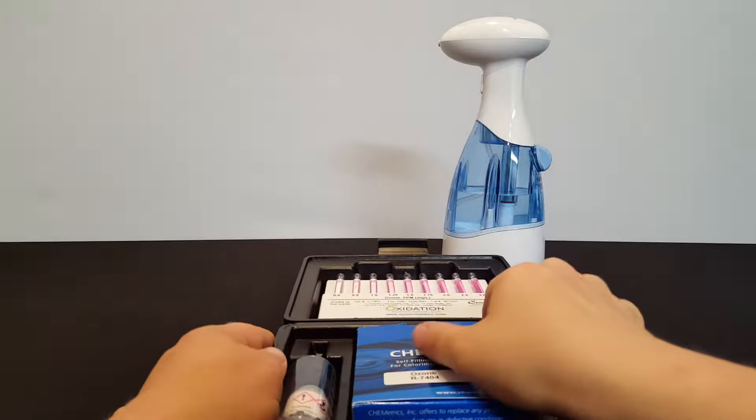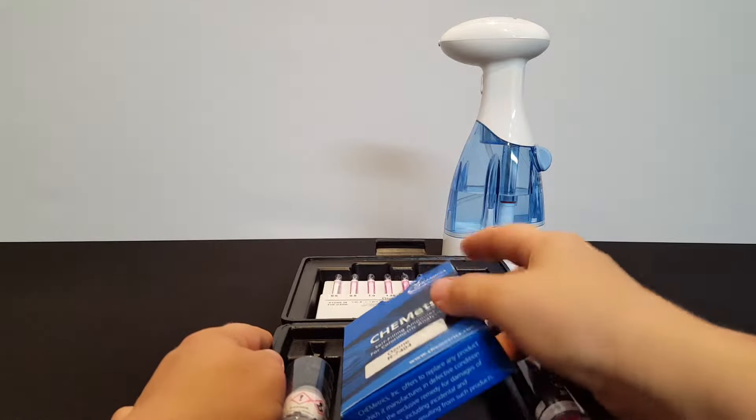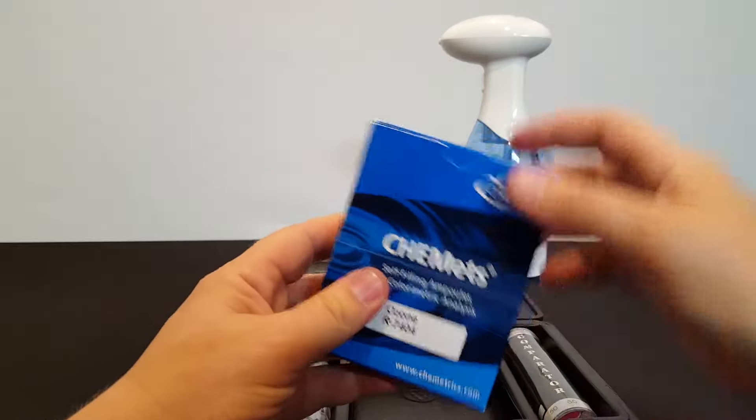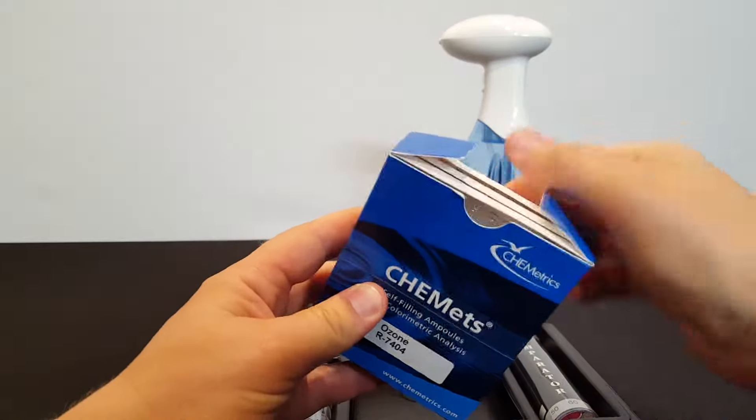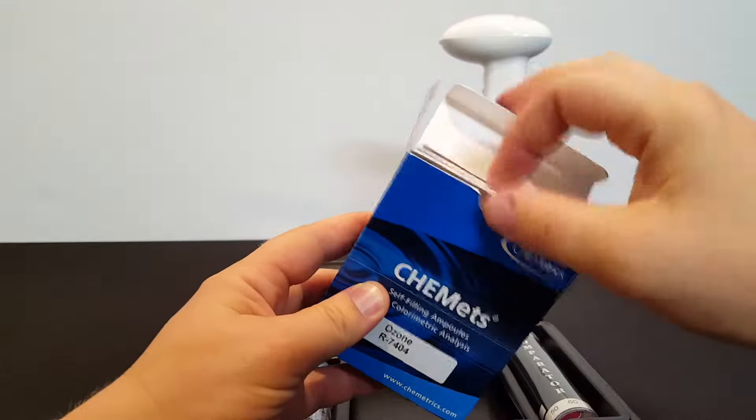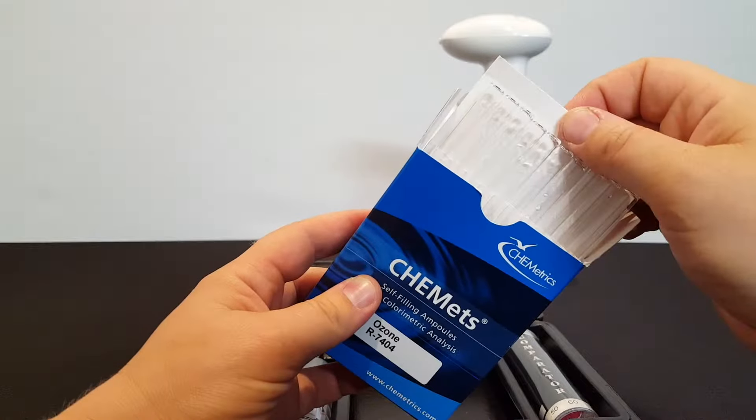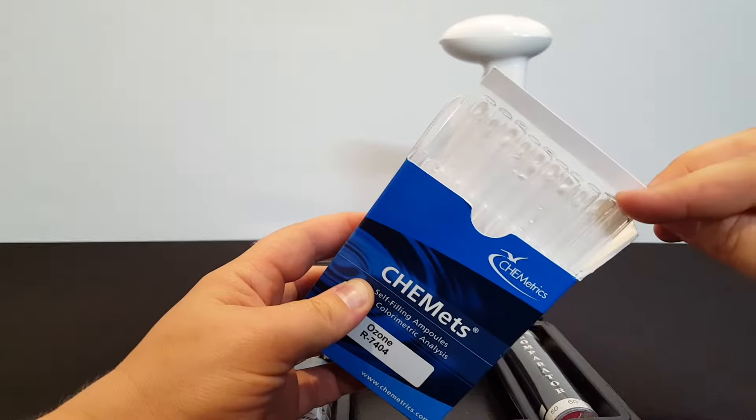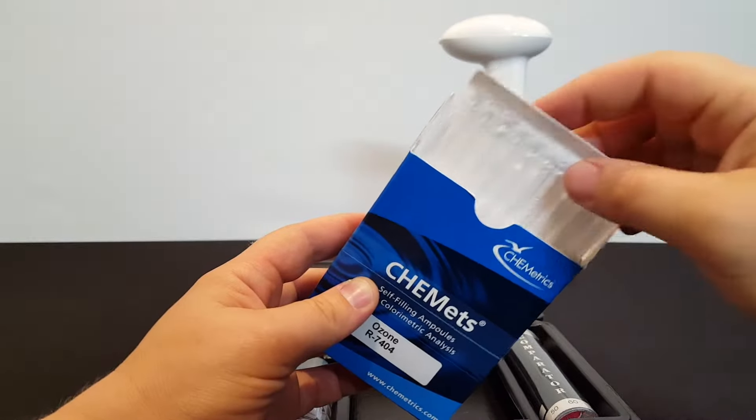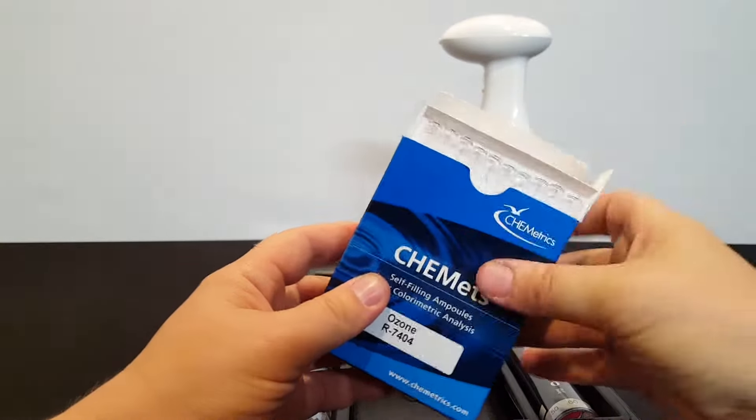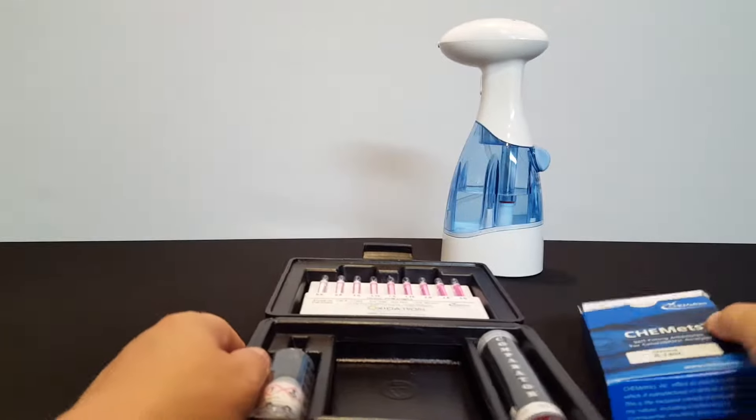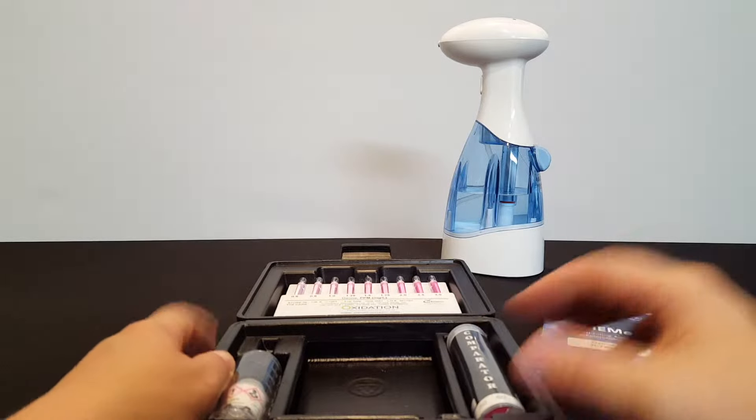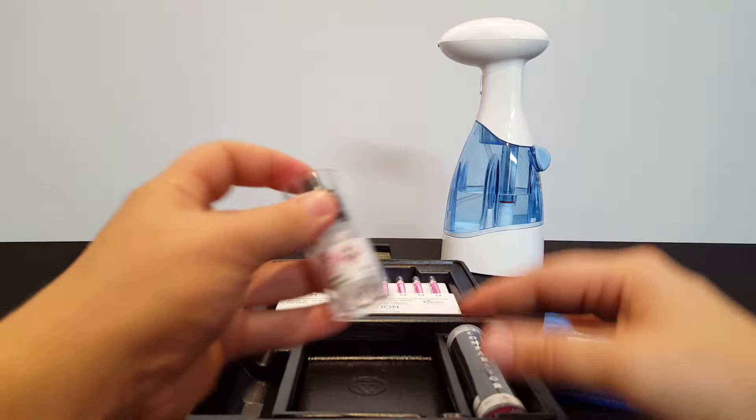Some of them are permanent items, others are disposable. The first thing we're pulling out here is the set of 30 ampoules. These are used up with the test and they are replaceable. We do sell replacements. One ampoule per test is used.